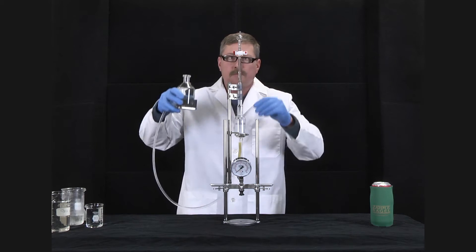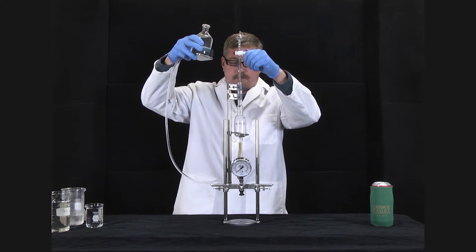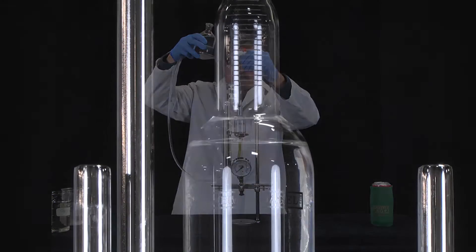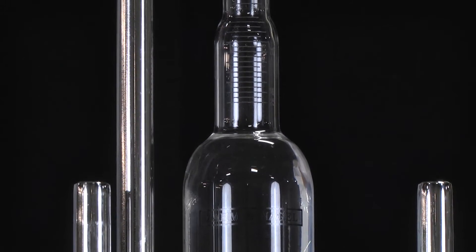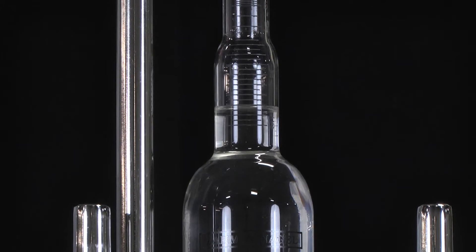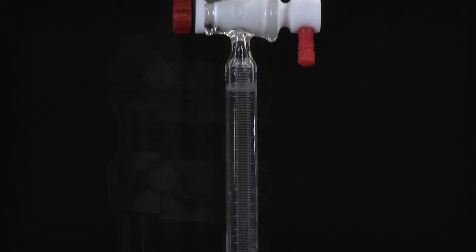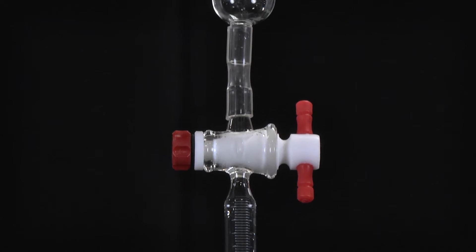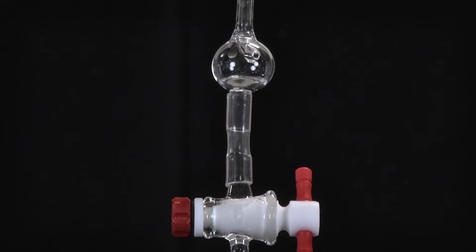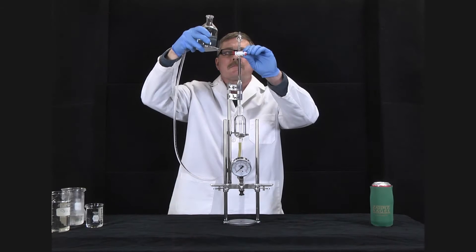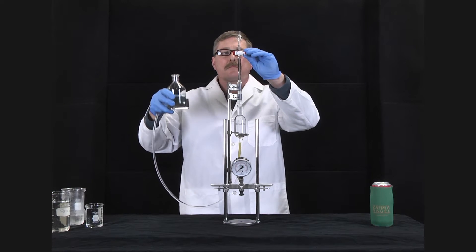Raise the level bottle to fill the burette completely and open the burette cock. Close the burette cock to prevent overflow and lower the level bottle.